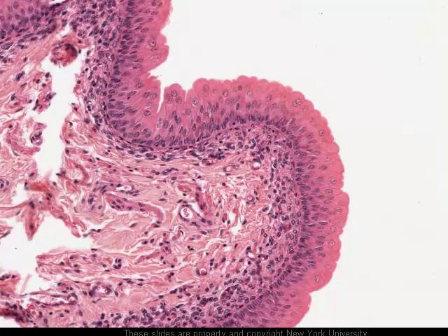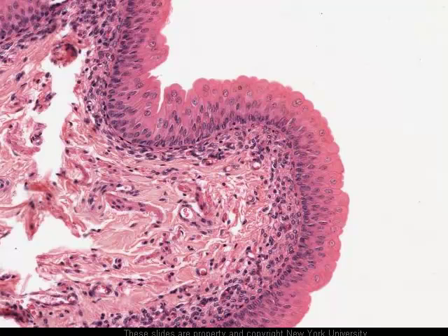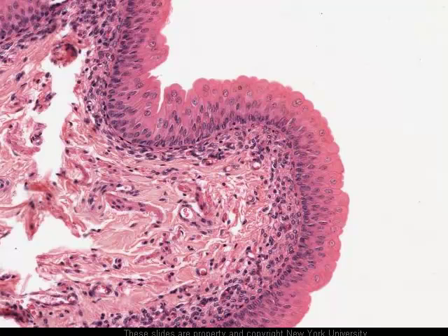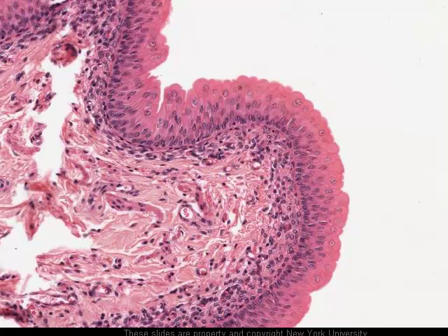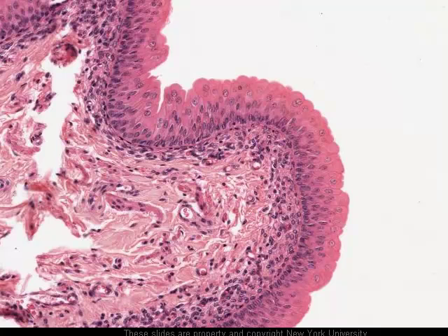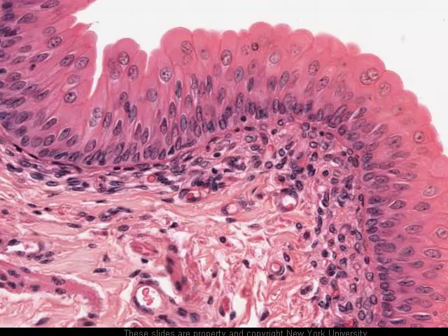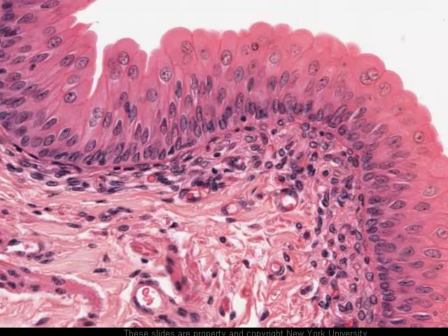Looking at the surface epithelium of the bladder, it should be clear that this is a stratified epithelium. The basal layer of cells looks like low columnar cells — they appear narrower than they are tall. As the cells progress outward toward the surface, they become progressively rounder and larger, until at the surface they form the so-called dome cells of the bladder. A particular feature of bladder cells, especially the dome cells at the very surface, is that they're frequently binucleate, as we can see in this particular example, although the specific importance of that I'm not able to say.